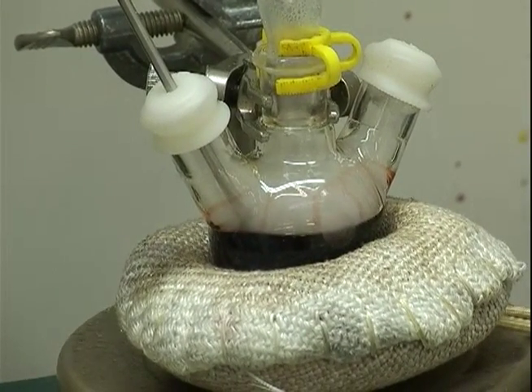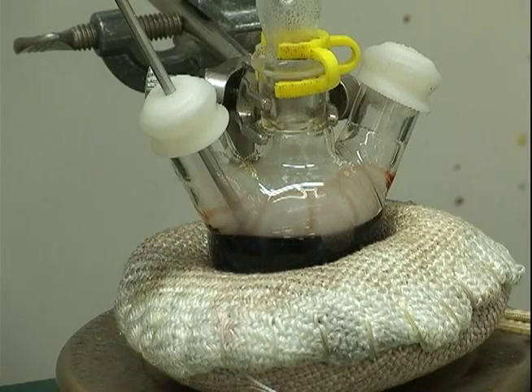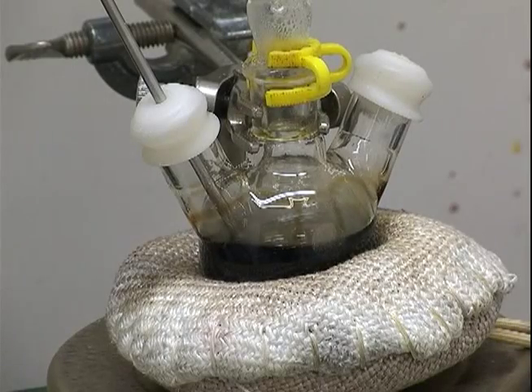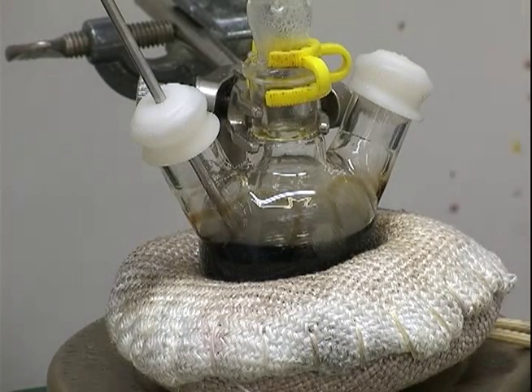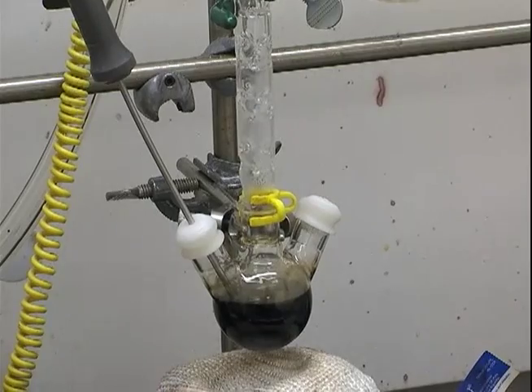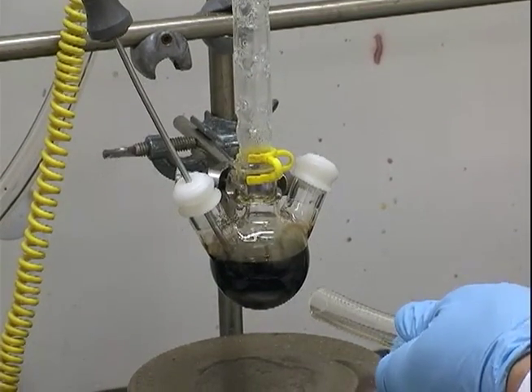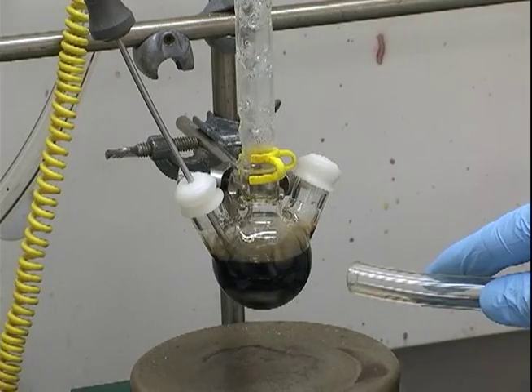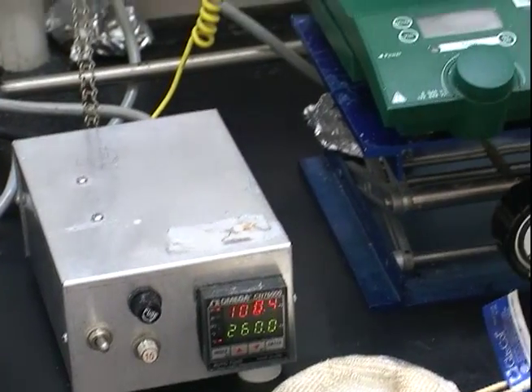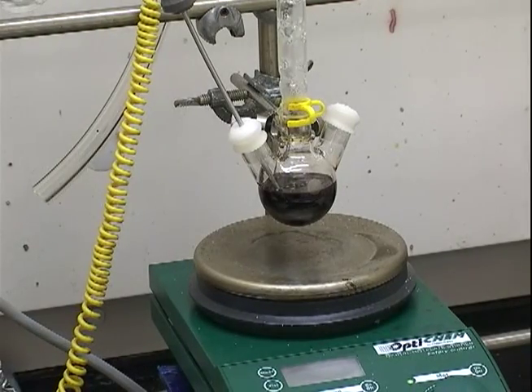You allow the particles to grow for whatever length of time you've decided. In this case we'll be growing for two minutes. We shift our growth temperature, setting it to 260 degrees Celsius. Once we've grown for two minutes, we assist the cooling by blowing compressed lab air over our round-bottom flask. We remove our heating mantle. Once you reach about 100 degrees, you can stop cooling and just let it cool naturally. Once it reaches about 60 or 70 degrees, we can start the purification process.